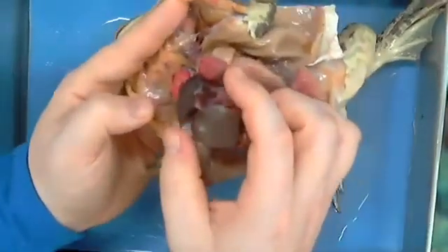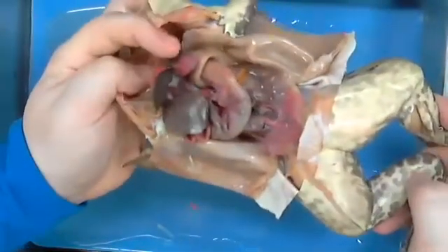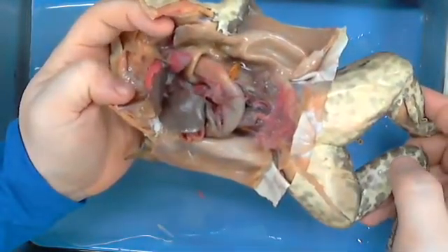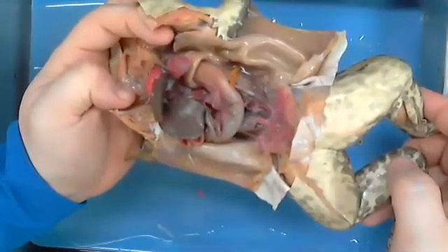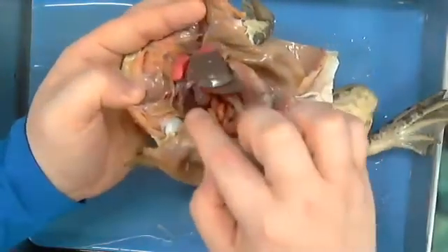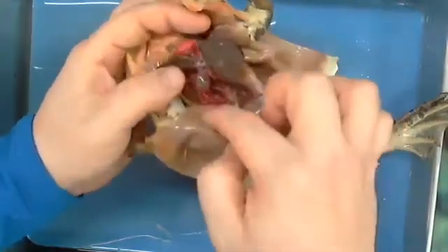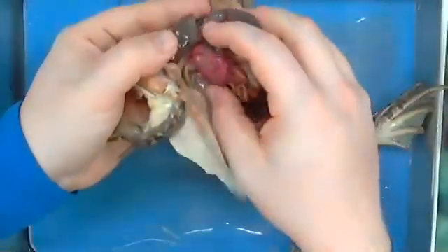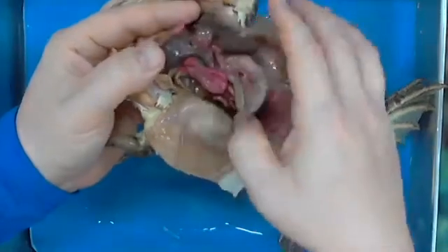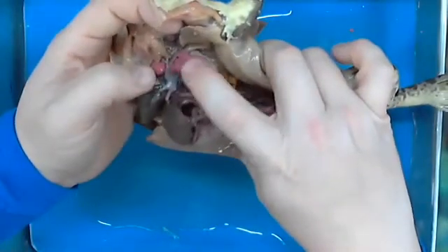Notice the size of his lung in this case compared to his entire body. I'm going to try to hold this up so that you can see. This is his lung, or one of them, right here. And again, we don't have lungs like that. That's because you and I don't get the ability to actually breathe through our skin. So he has a lung here, and if we were to look on his other side, you will see that he has another lung as well right here. You can see, in this case, this one has been basically collapsed. But you can see this lung, and then as you turn over on the other side, you see the same thing over here with this lung. So this is how he breathes.